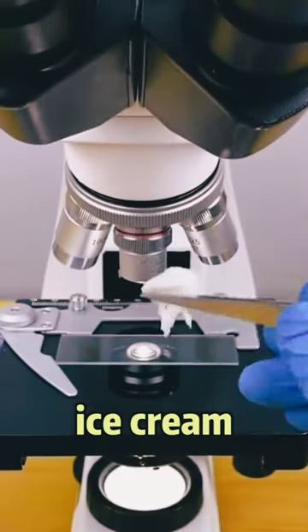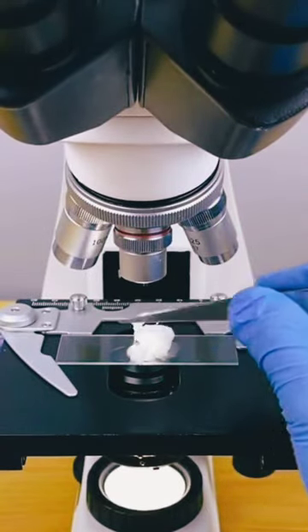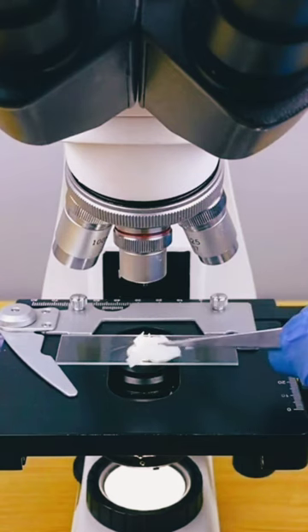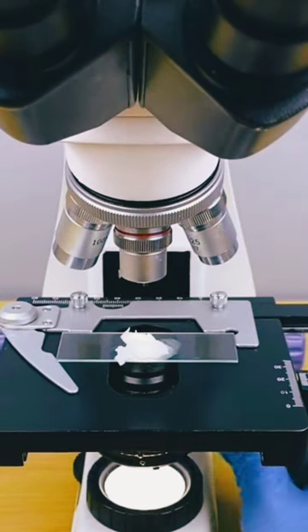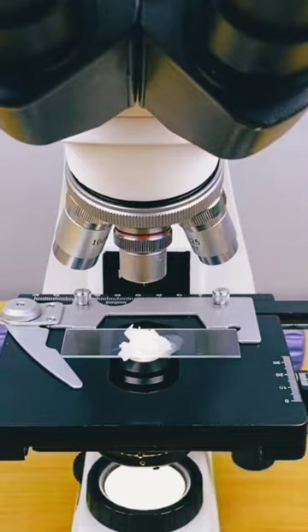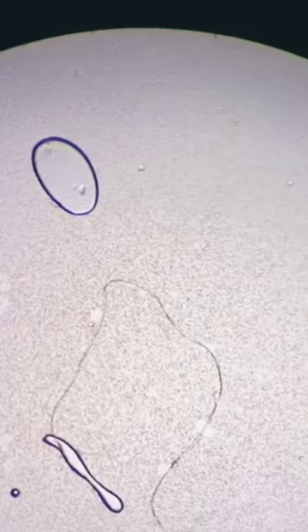Get an up-close look at ice cream under the microscope and see its amazing details. Observe the intricate crystal structures and the pockets of air that make up its creamy texture.